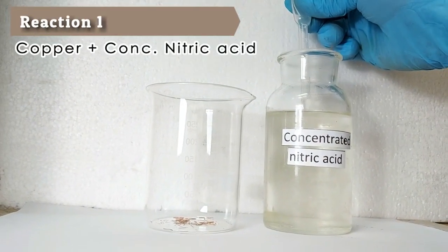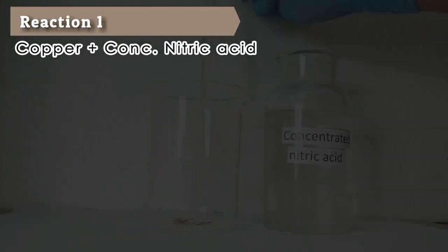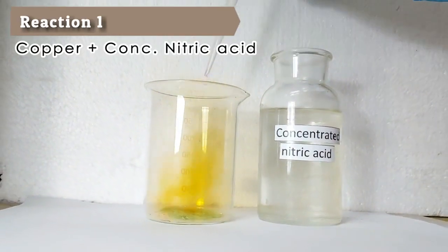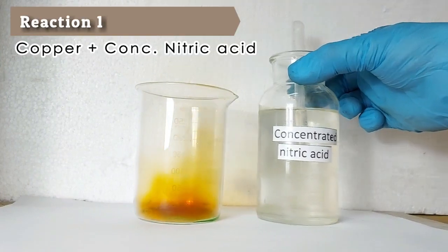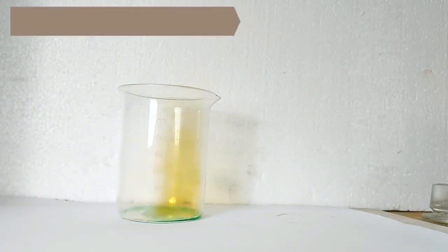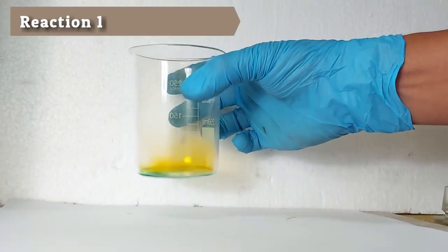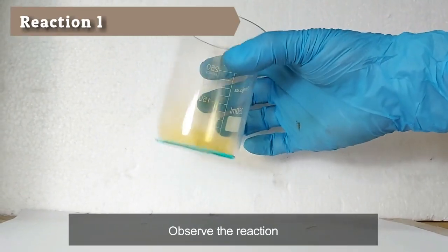Place the beaker in the fume hood and add 1 ml of concentrated nitric acid. Swirl the solution carefully in the beaker until the copper has completely dissolved. Record your observations.